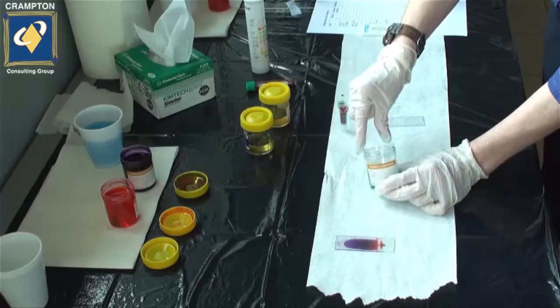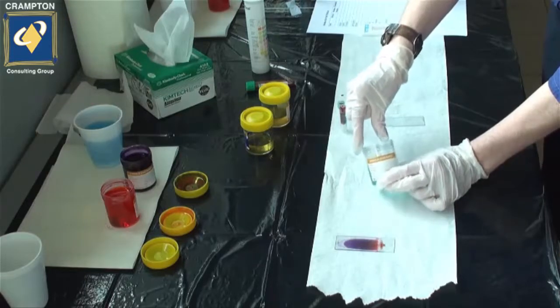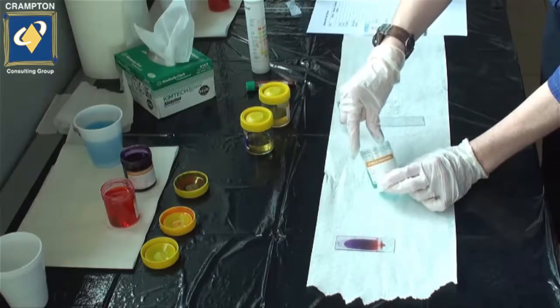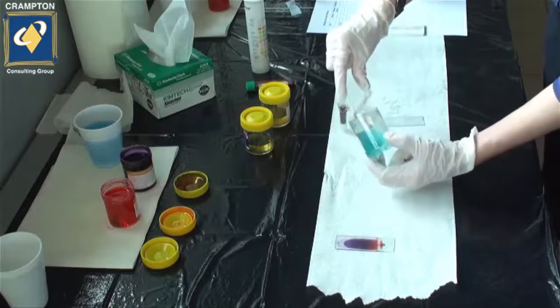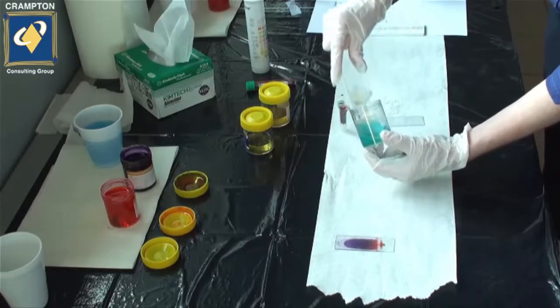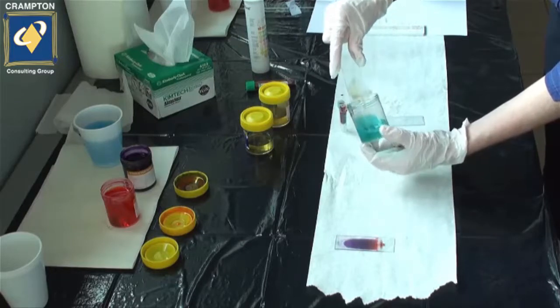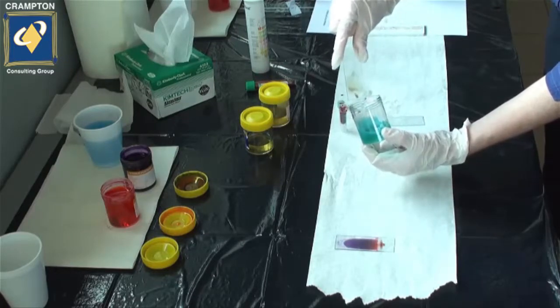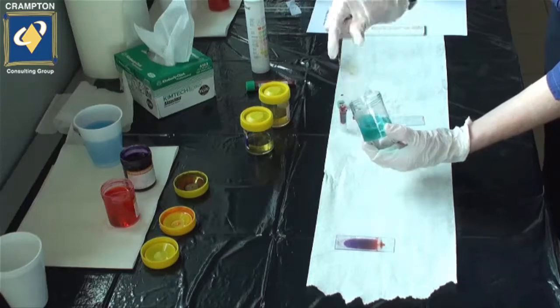Dip the slide in. Ensure that it is adequately covered in the fixative. We generally do five to ten dips.